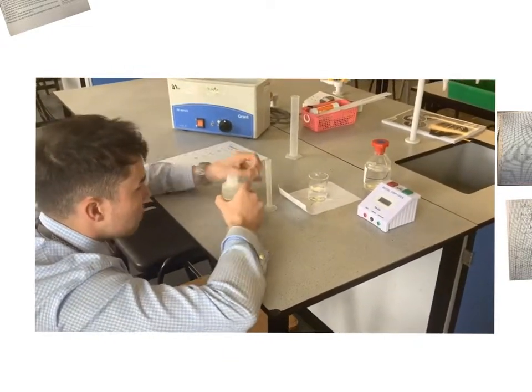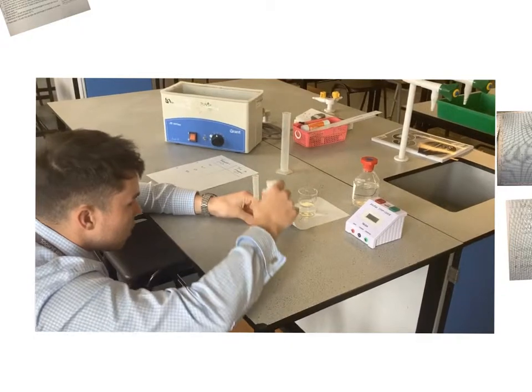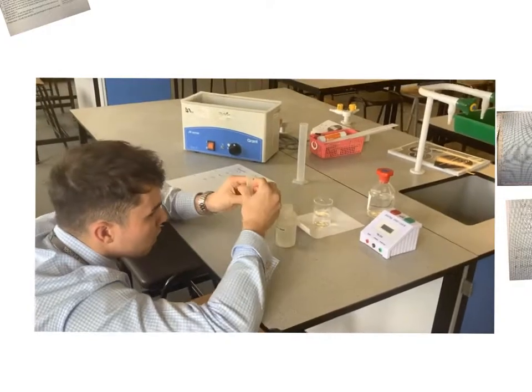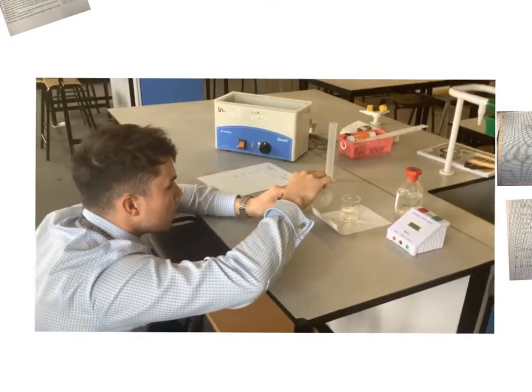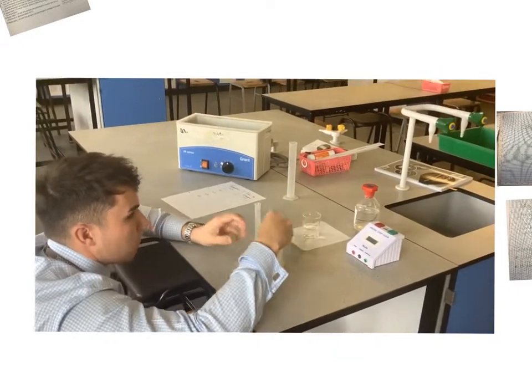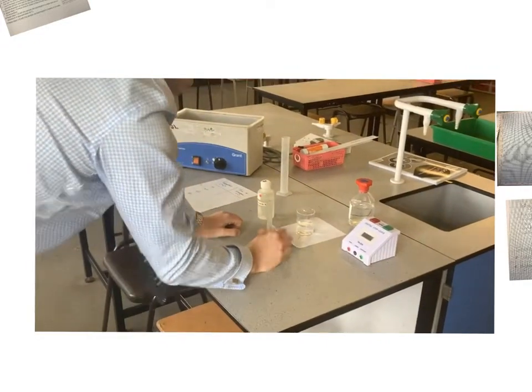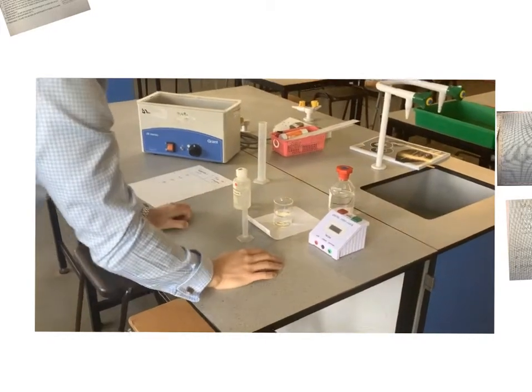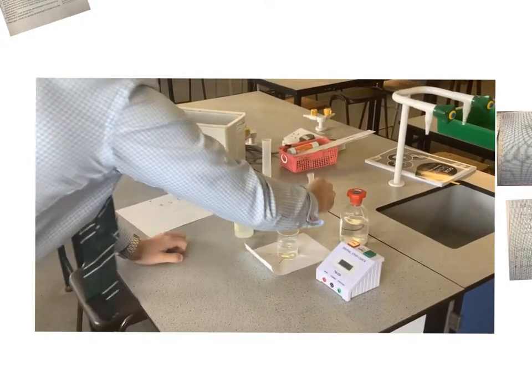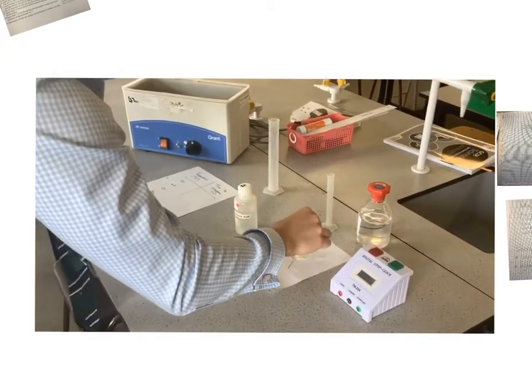Okay, and again, just make sure you're down. Quite hard to measure 5, isn't it? Yes. I should use a pipette. So that's another way we could improve this then. Pipette, and that's bang on there. Okay, now the next thing which I'm going to do, as soon as I add this hydrochloric acid in now, I'm going to start the stop clock, and then give it a swirl to start the reaction going. That's in there. Start it going. And then it's just a waiting game then.